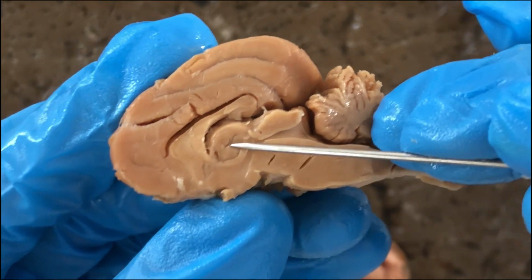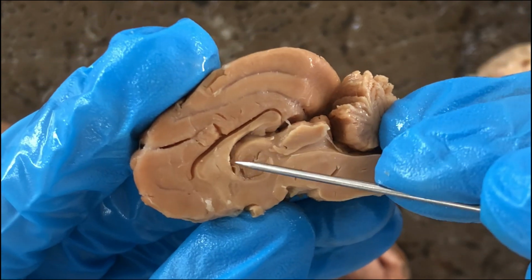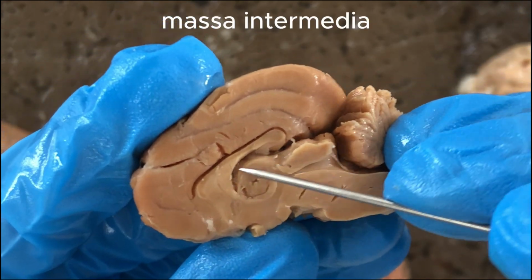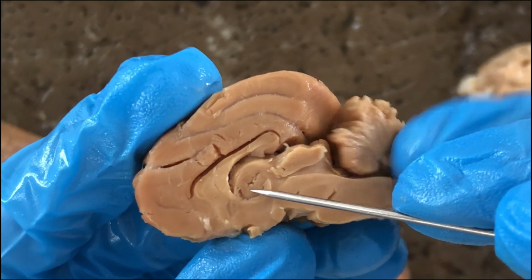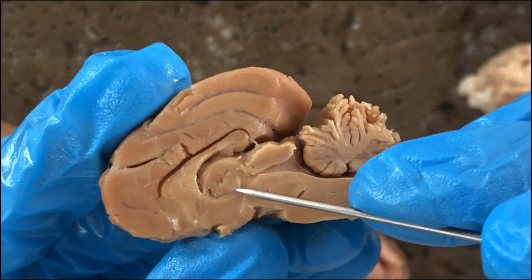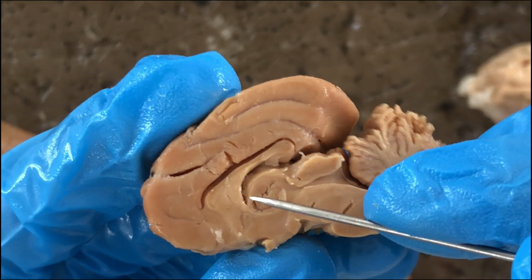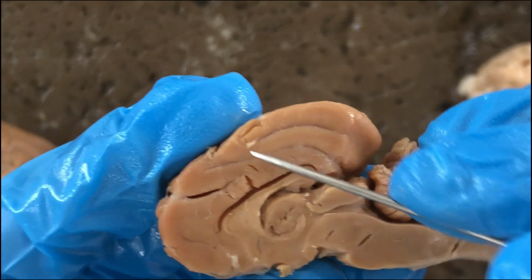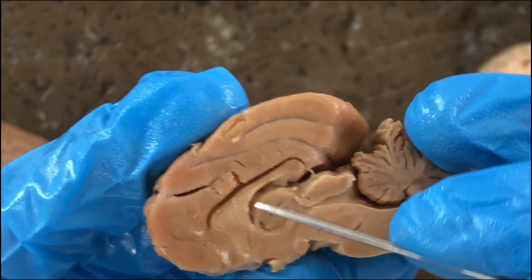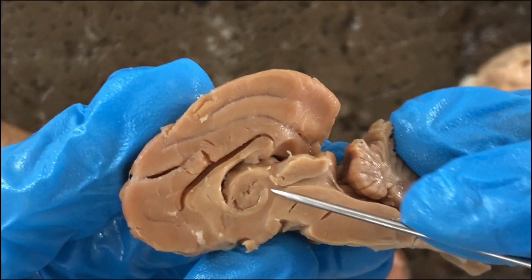So this rounded structure here is part of the thalamus, called the massa intermedia, or intermediate mass. So the thalamus is the part of the brain where a bunch of sensory signals are relayed into for further transmission to the higher portions of the brain. So it's like a sensory hub, the thalamus.